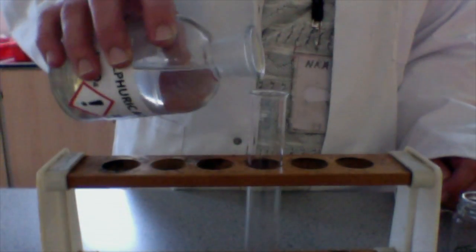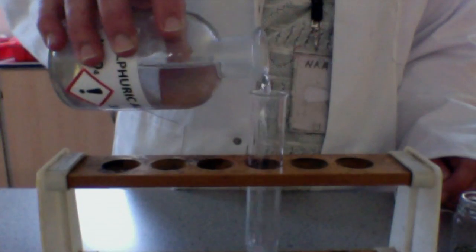I'm going to make sure I'm not holding the boiling tube as I pour some sulfuric acid in there. So here's my boiling tube with some sulfuric acid in. And all I'm going to do now is drop some magnesium in here.